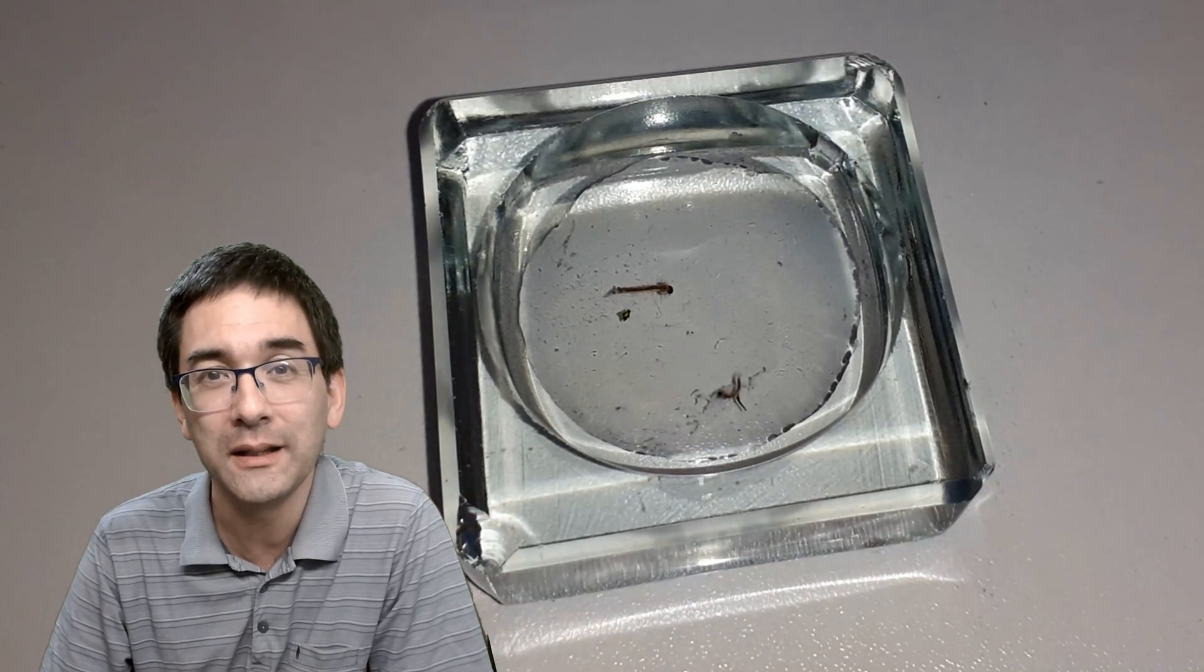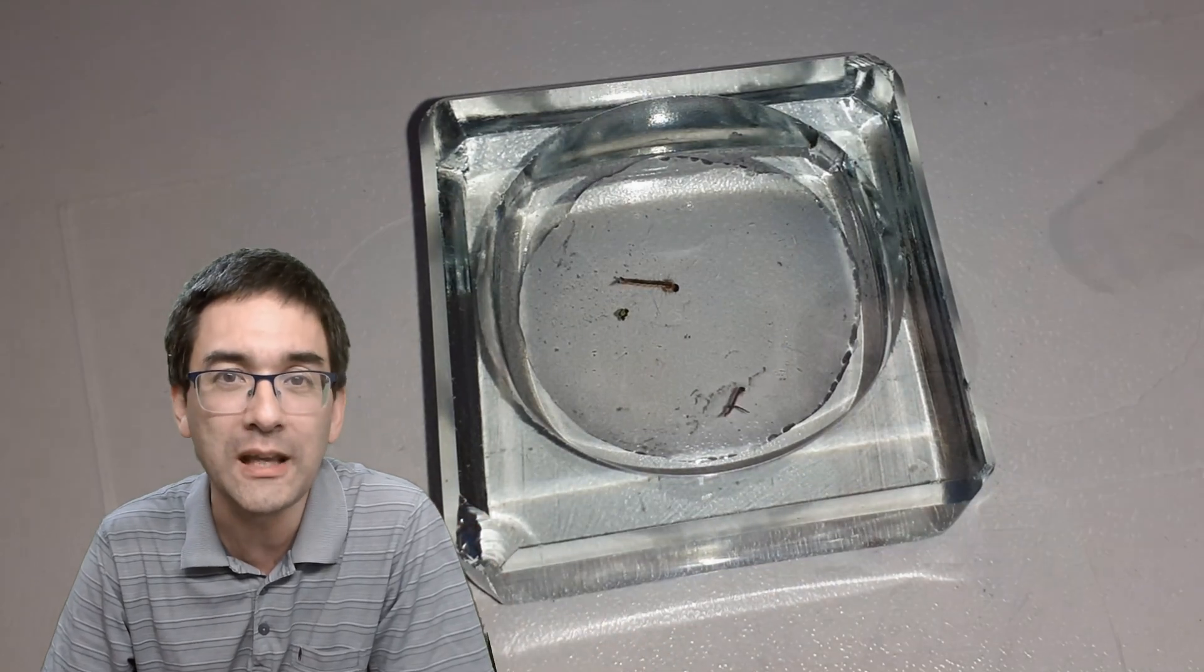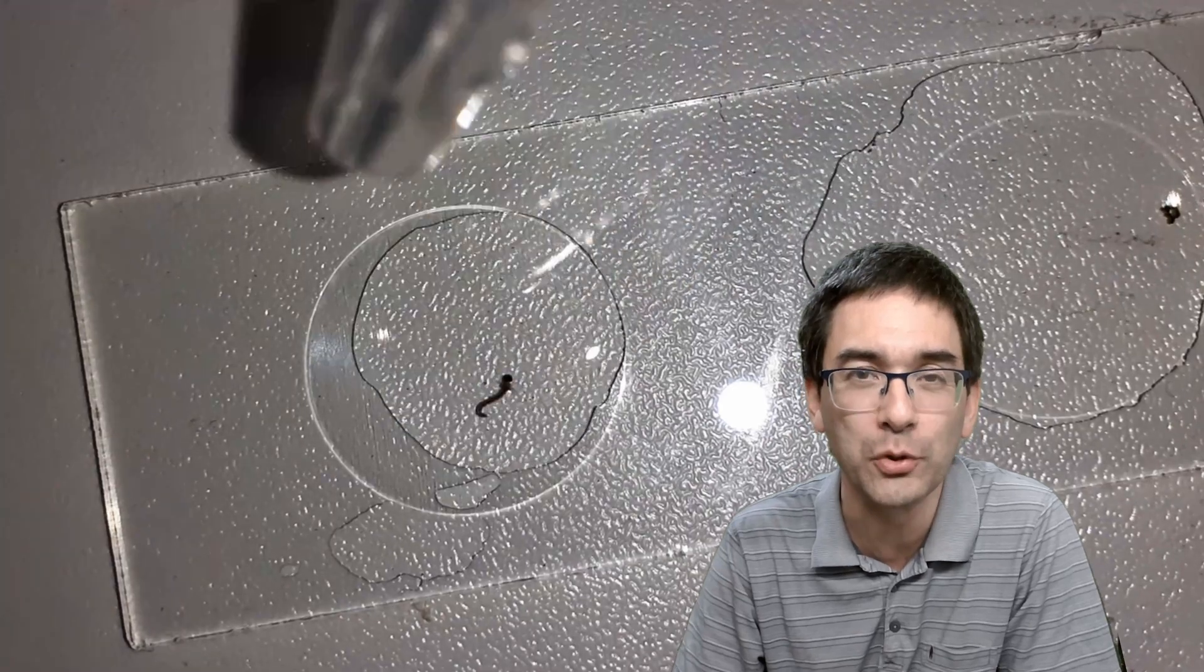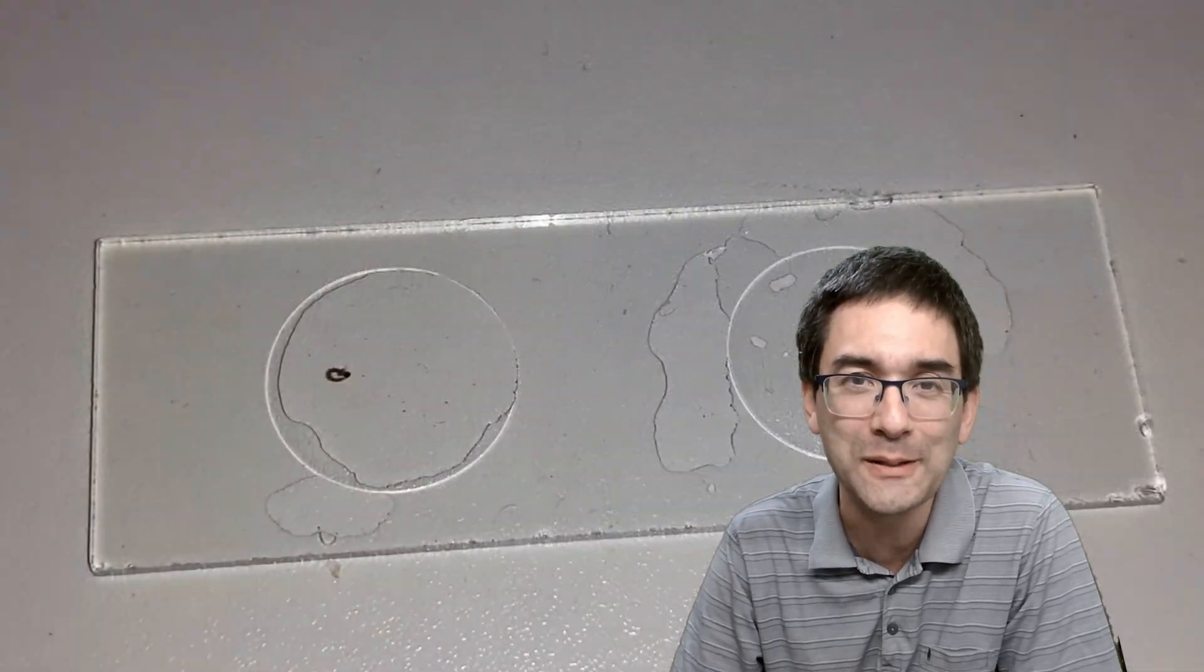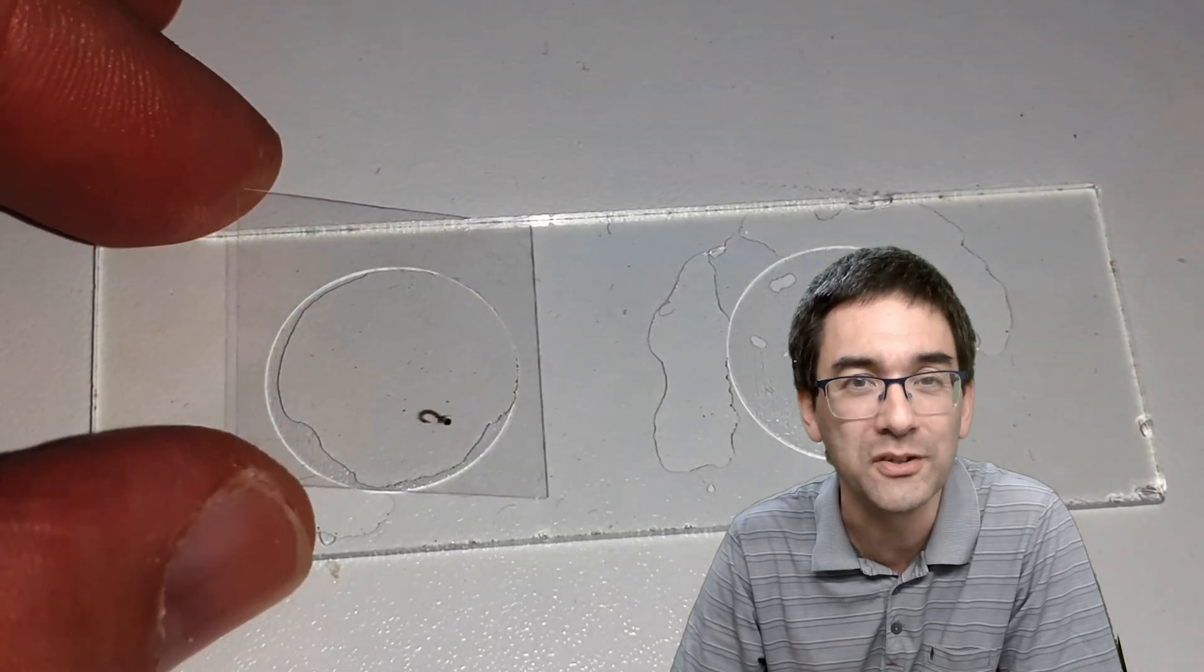Here there are two of them and then I put them on a concave microscope slide. Those microscope slides have a small indentation as I already told you, and this prevents the mosquito larvae from being squashed.